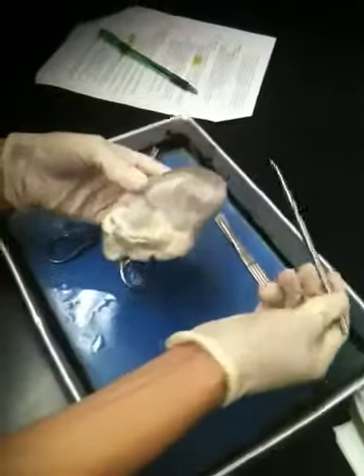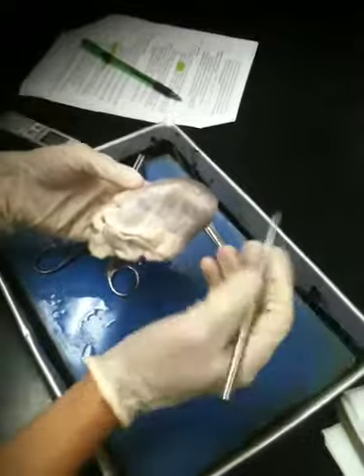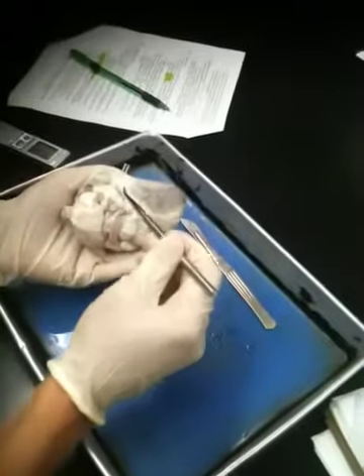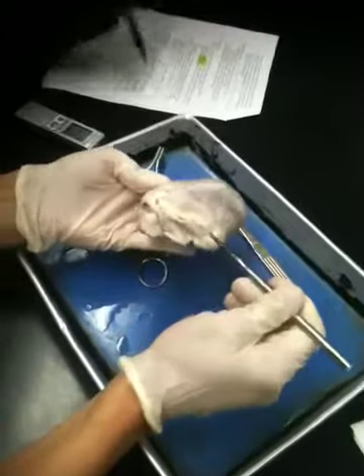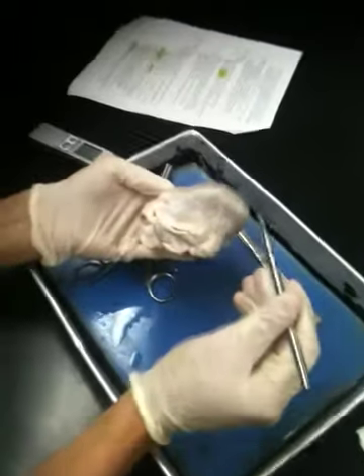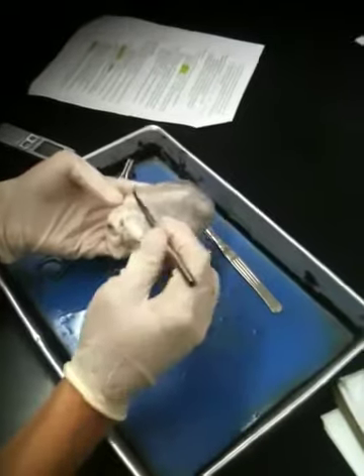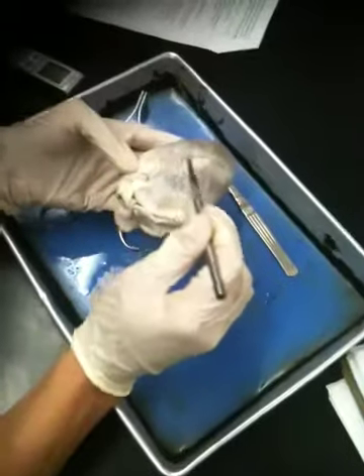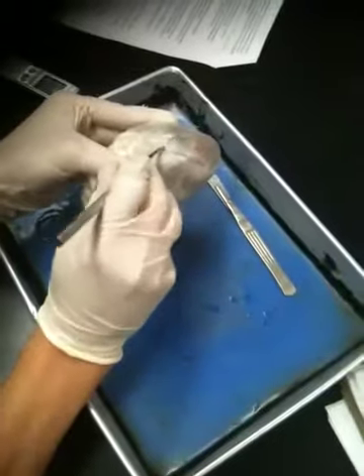What if I pointed right here and asked you to name that region? Apex. Of course, the apex, exactly. What tissue do you think you're seeing along here and along that sulcus and along this area here? Pericardium? Nope. What tissue are we seeing in white here and here? Adipose. A lot of the sulci around the heart are mainly filled with adipose tissue. So that diagonal line is a sulcus largely filled with adipose to cushion the coronary vessels inside.